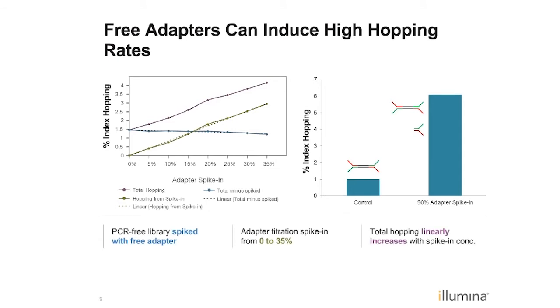So free adapters can induce high hopping rates, and this is actually a figure that is taken from our white paper, which I'll reference at the end of the presentation. But what we did here is we took PCR-free library, spiked in with free adapter over a range of 0 to 35%, and you can see that this library started out with, say, 1.5% total index hopping, and as we spiked in the free adapter, you can see the total index hopping goes up pretty much linearly, get a linear dose response with the free adapter that's added.